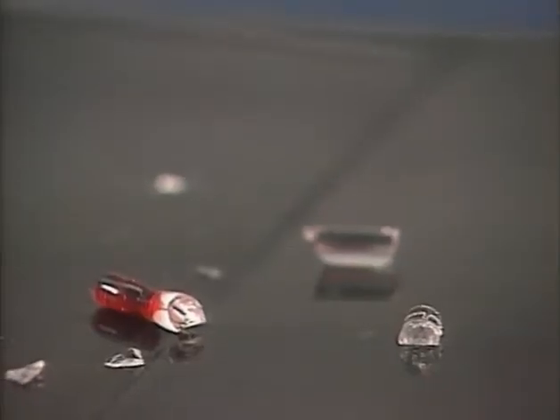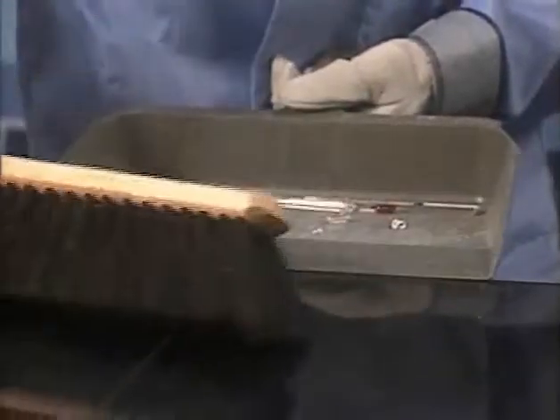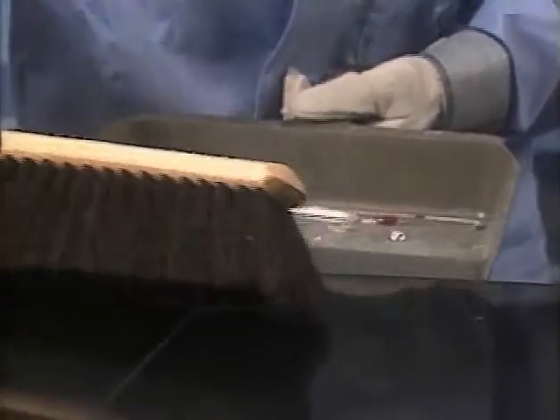When a thermometer breaks, the glass and any liquid that spills out must be cleaned up and disposed of properly — this is a job for your teacher. Glass fragments can be swept up; if any alcohol escapes from the glass, it can be wiped up with a paper towel.